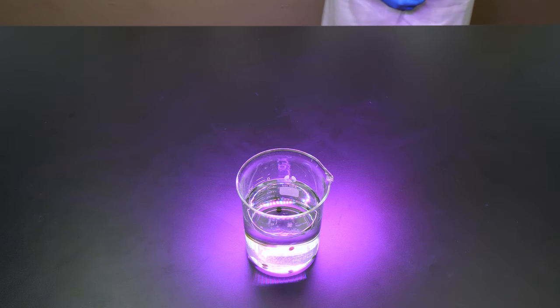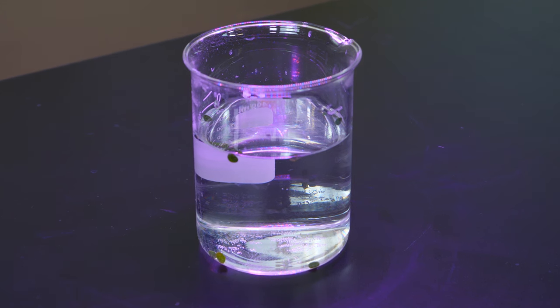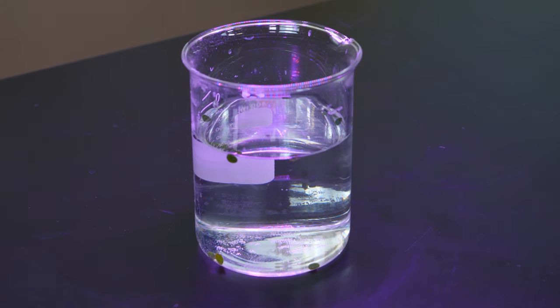As oxygen bubbles form inside the chads, they will become buoyant and float. This will take several minutes, so we will leave the camera running and speed up the action.